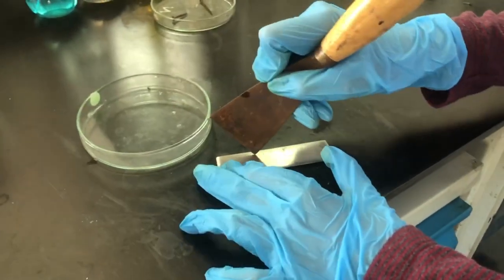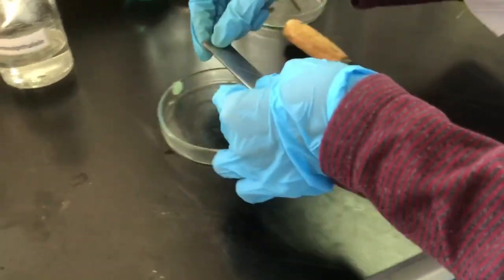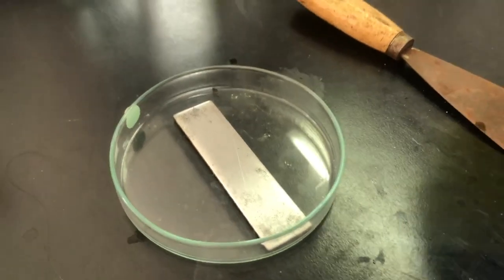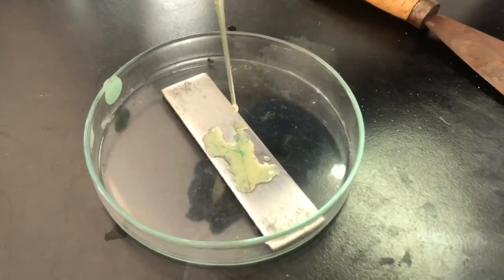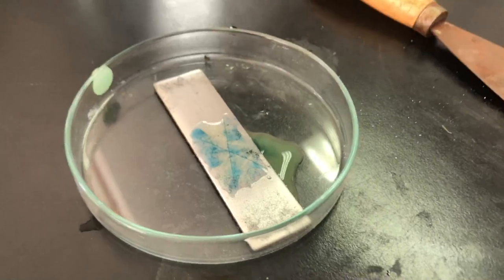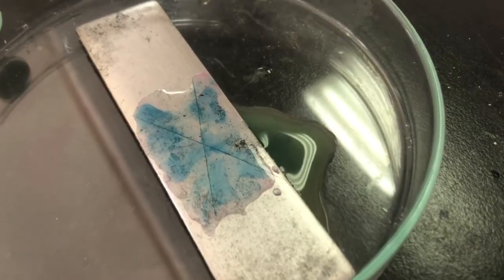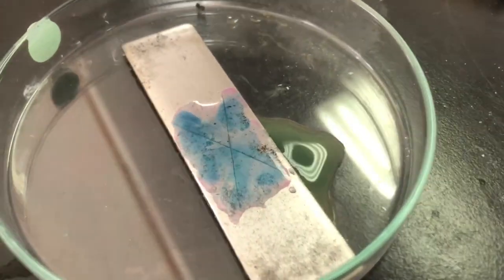For the first part, we have a polished plate of iron. The student makes an X mark using a metal scraper — push it hard. Place it on the Petri dish and cover the X mark with the ferroxy indicator prepared earlier. Leave it aside for a while until it produces a more visible color change. Even now you can see some blue color forming, especially at the scratch area, and some reddish color at the edge of the drop.